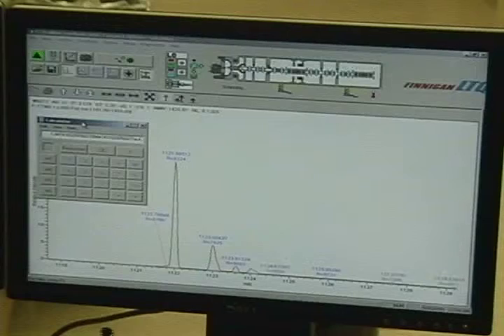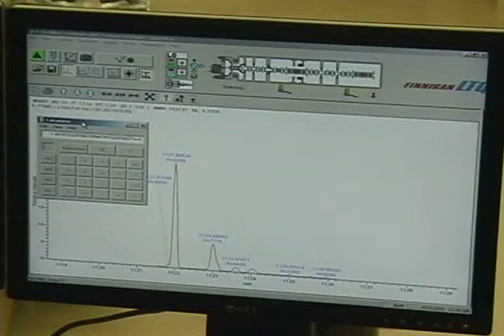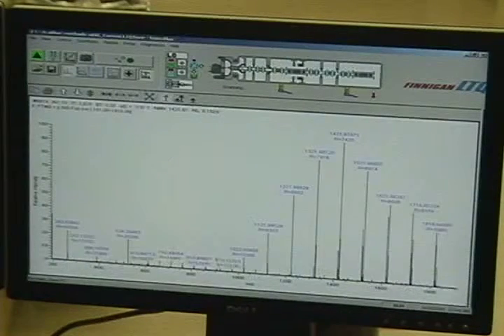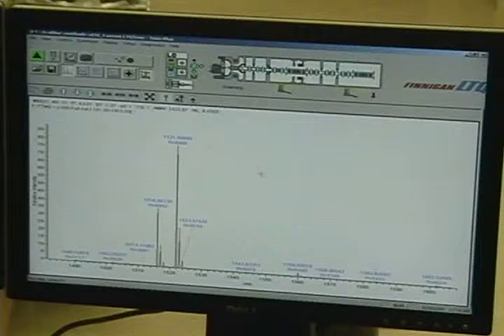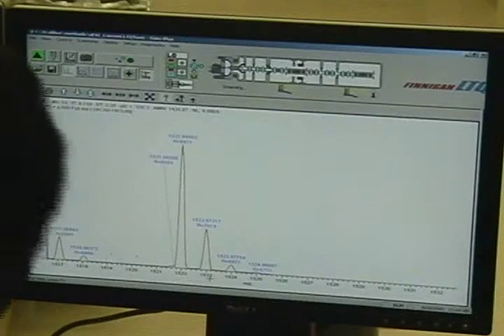ppm. 995, we should be 997, so 2 milli mass units, which is only 1.5 ppm. So did you figure out? Yeah, the first mass calibration looked like it just sucked. Even though, so why did it pass and suck? Because we do RMS. Root mean square, so we do them all together.